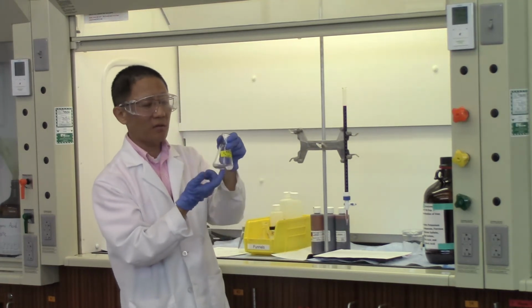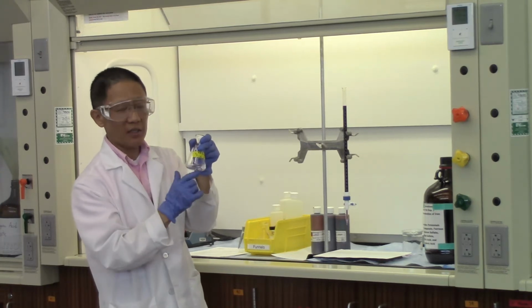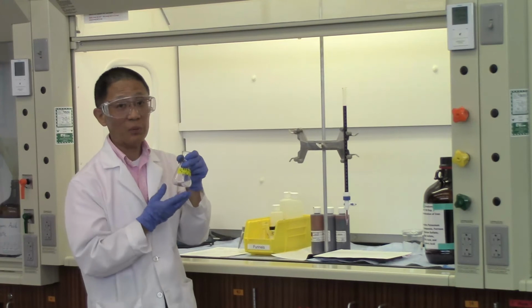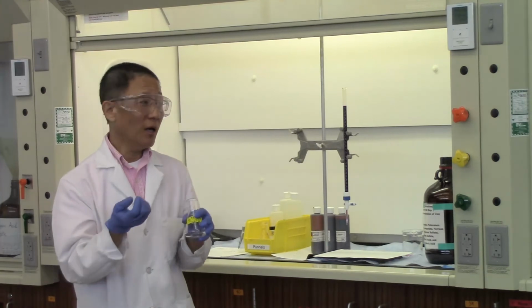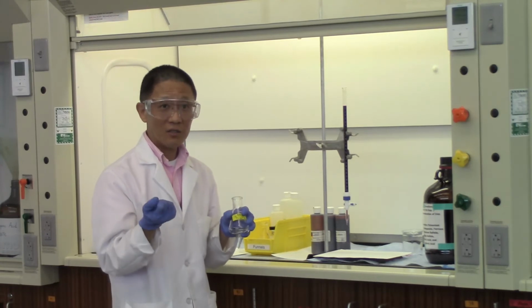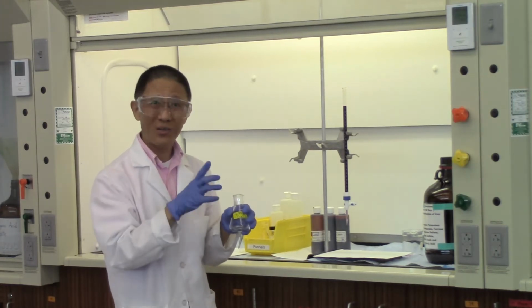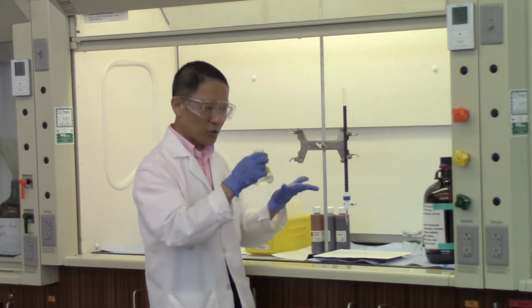And you want to get to the end point where you have a very faint pink color present in here. And when you see that pinkish color, persistent pinkish color, that means there's no more Fe2+ in the solution. And when you see the pink color there, we know that we reached the end point. As always, when we do titration, I try to emphasize here, the point for titration is not for the color change. Rather, what is the minimum amount of chemical that is needed in order to reach that color change? If you dump too much chemical in there, you get the color change, but that doesn't give you any useful quantitative information. Okay, so let's do this titration together.